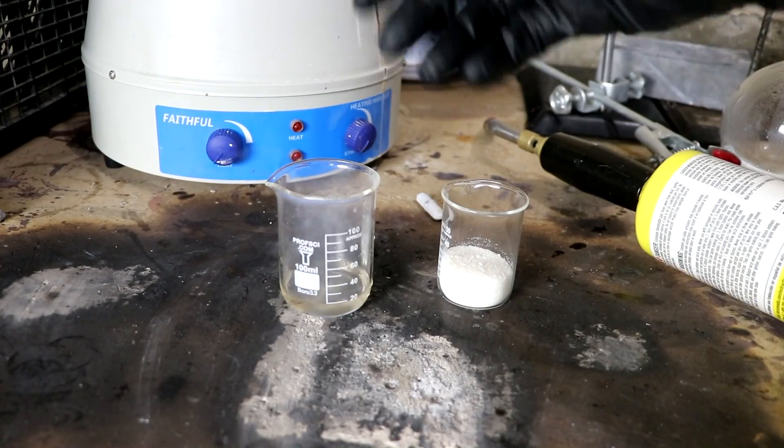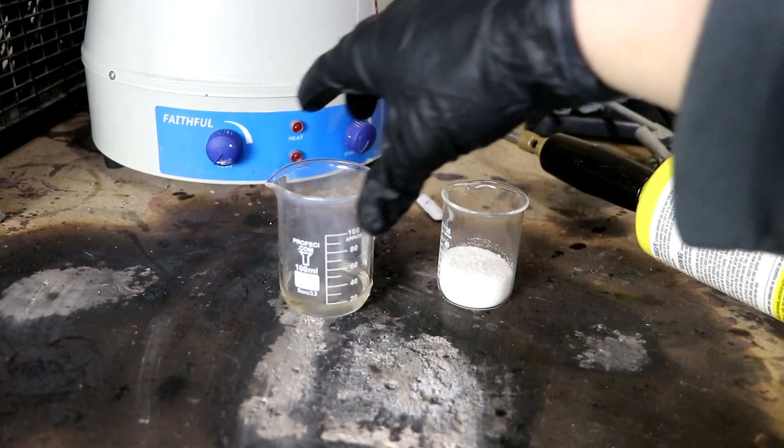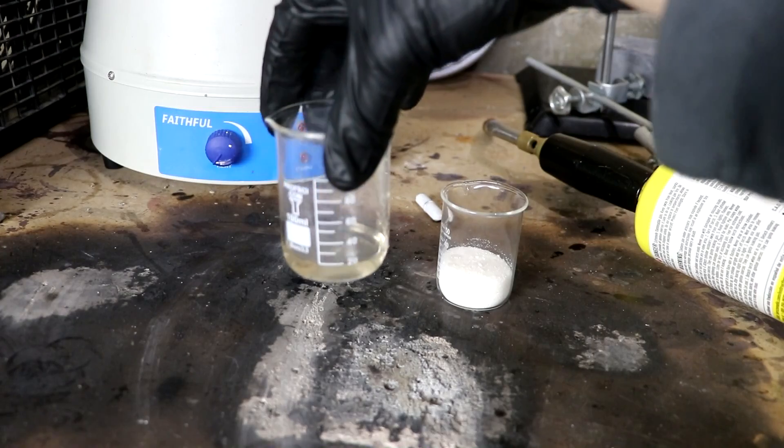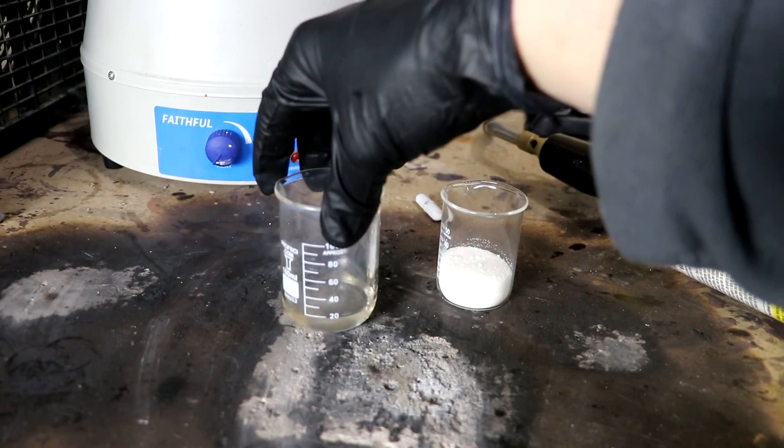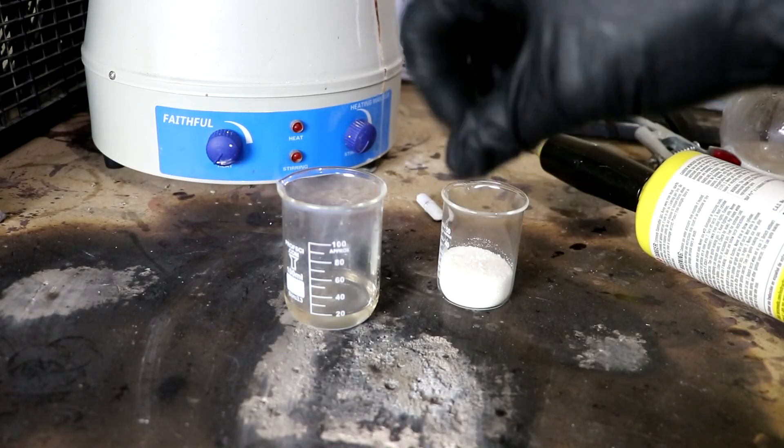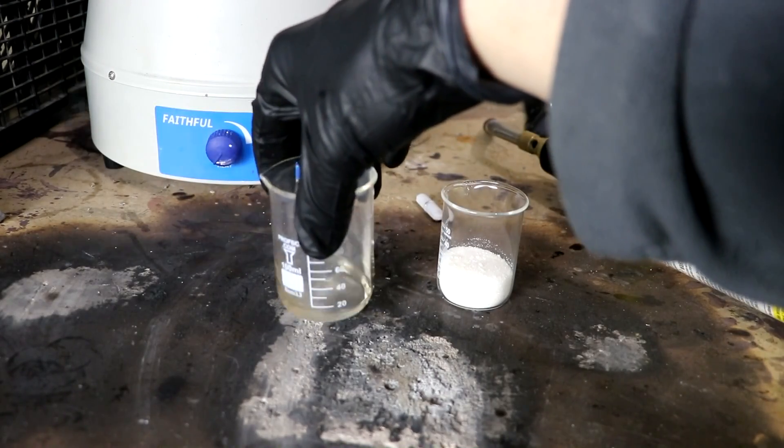I could produce the sulfur dioxide by burning sulfur, for instance. Yeah. That does look like more than I would expect just from reacting the sulfur dioxide with nitric acid alone. So it definitely had a catalytic effect.